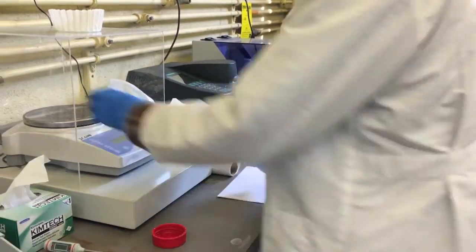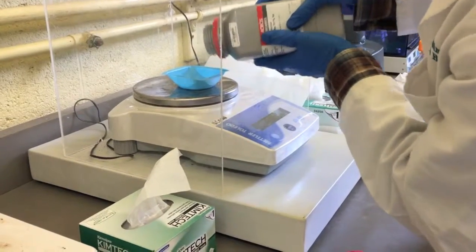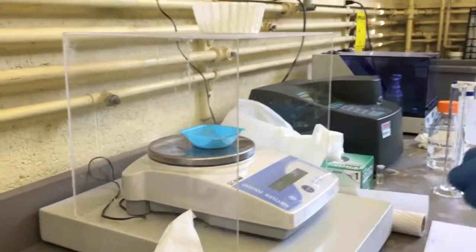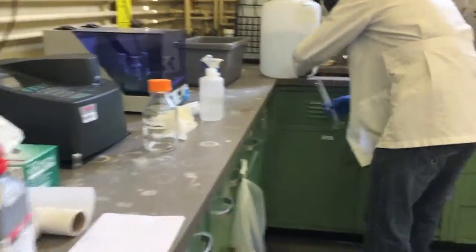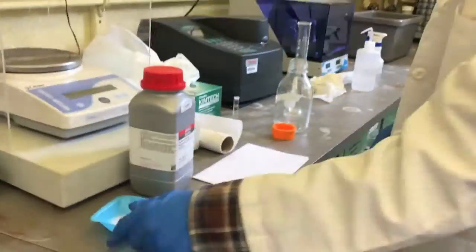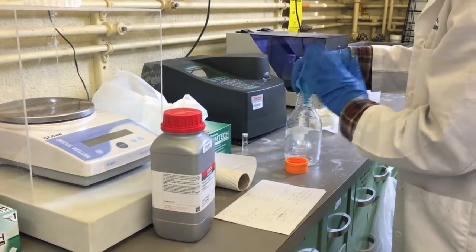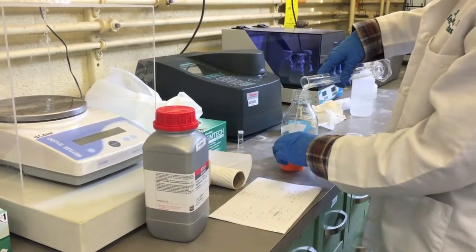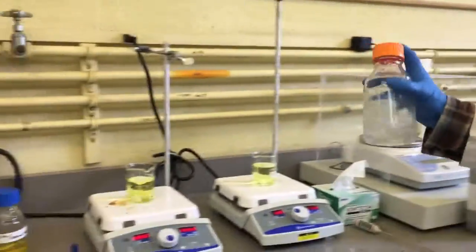To make the alginate solution, we added 1 gram of alginate to 100 milliliters of a 0.5 grams per liter tartrazine stock solution. We then prepared a 6% by weight calcium chloride solution from distilled water and calcium chloride hexahydrate. The calculations for this solution were slightly complicated by the fact that the calcium chloride already had water molecules in it.